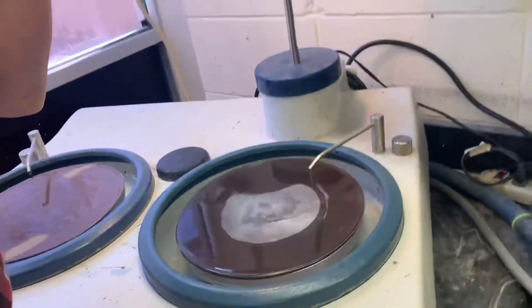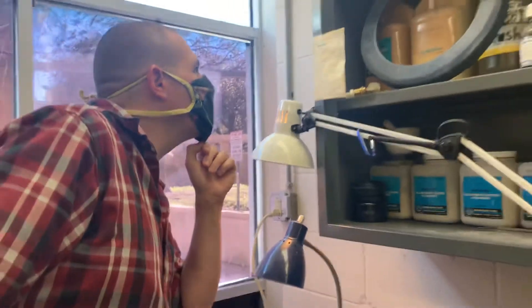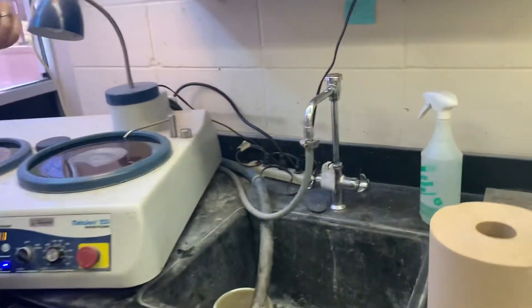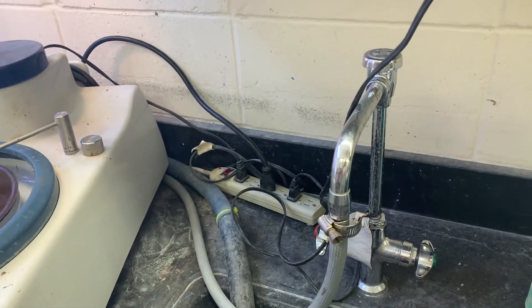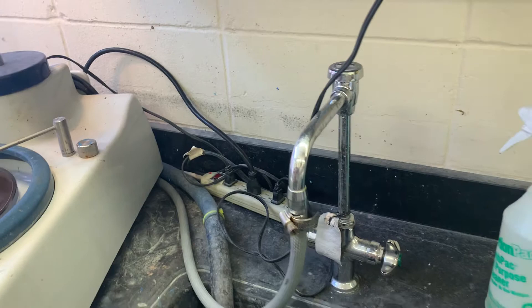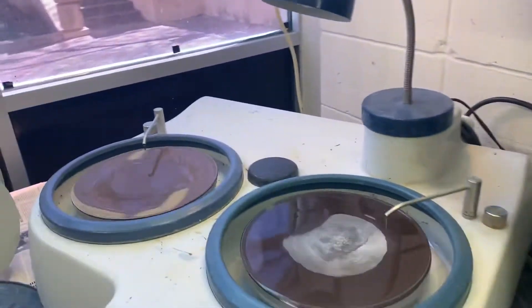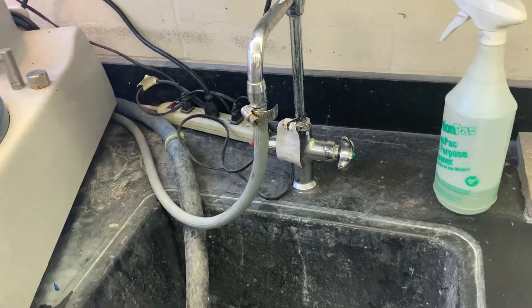There's extremely faded guidance here about how to do this — really hard to read. Okay Phil, let's walk them through the whole situation. Step number one: you have to put the power strip on. Step number two: they have to turn the machine on back there. There's a faded button that says 'on', and then they have to turn it so that the water turns on.